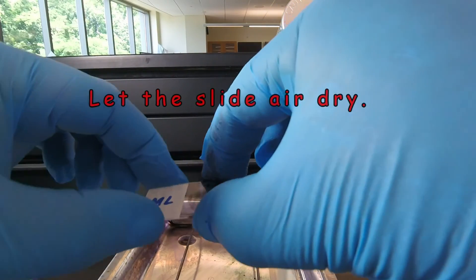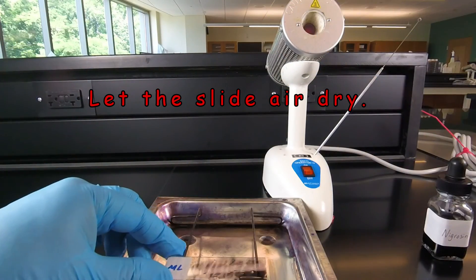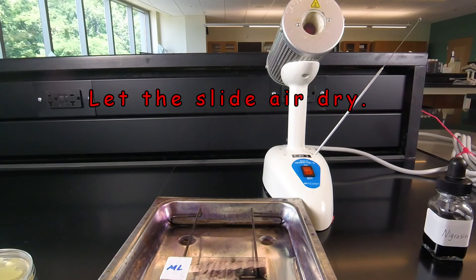So once we've done our tap and drag, we're simply going to let this slide air dry. Then it'll be ready to view through the microscope.